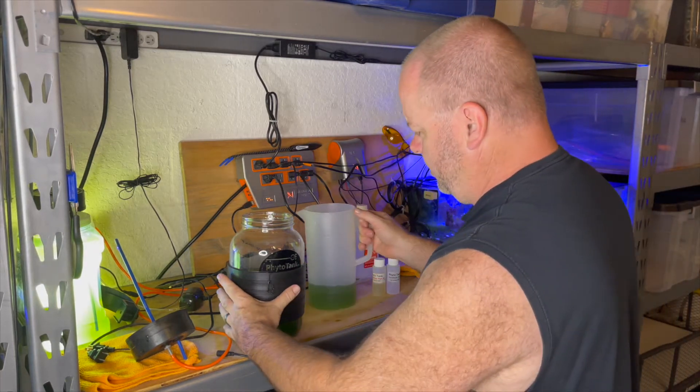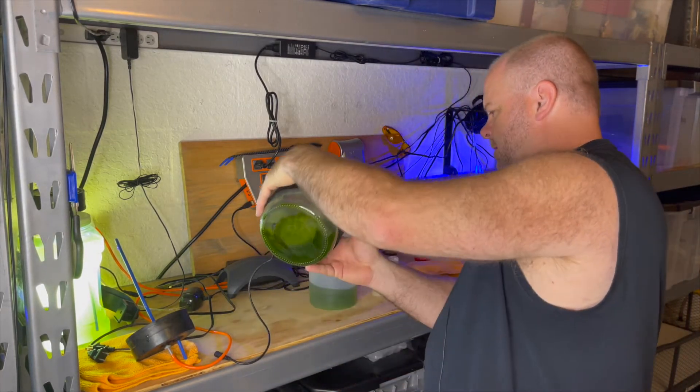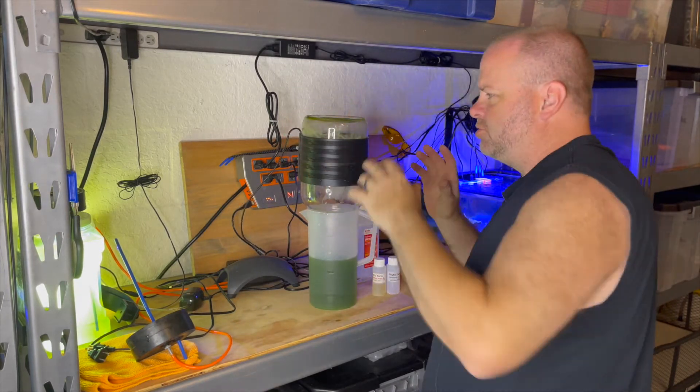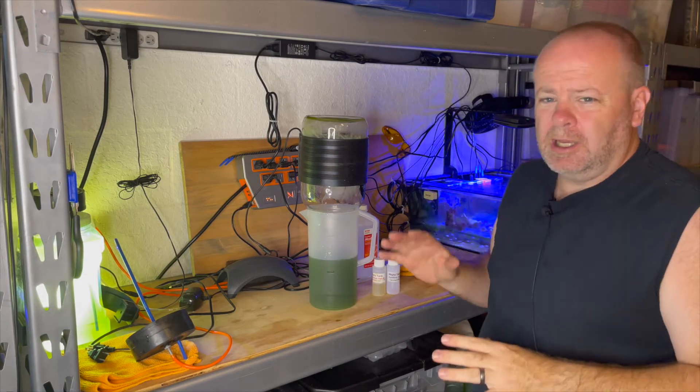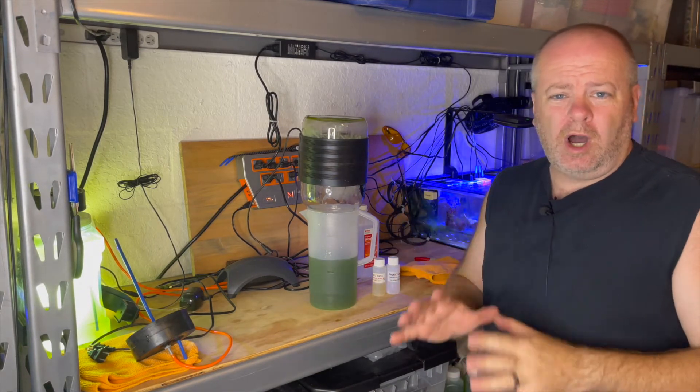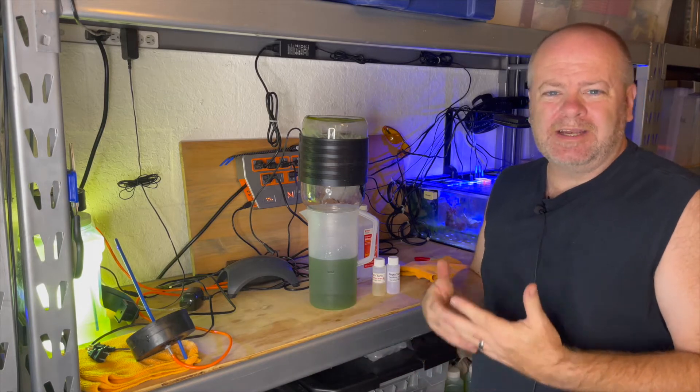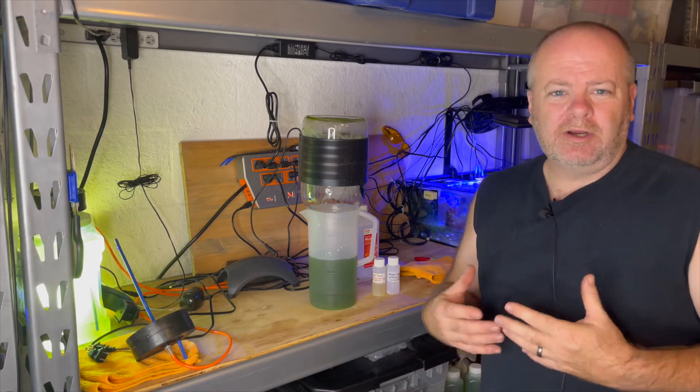I'm going to get the rest of my culture out of here. I'll let that drip for a minute. And then what I'm going to do is I'm going to take the jar and I'm going to wash it thoroughly before I put the culture back in. I want to have it clean just to make sure that I don't get a crash culture.